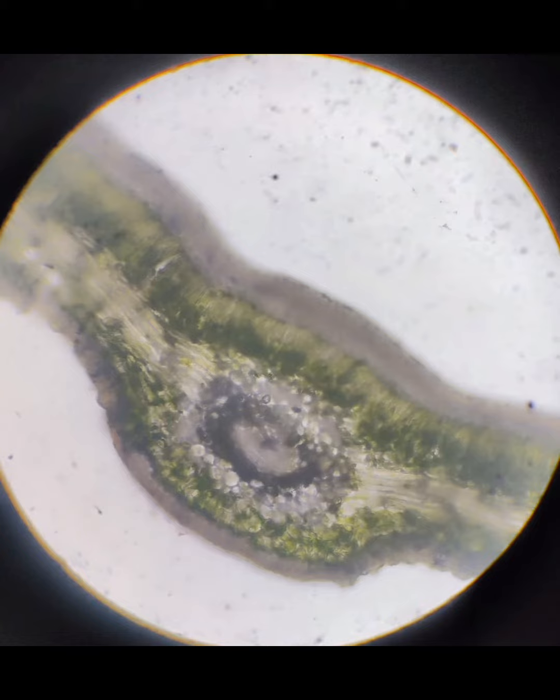The vascular bundle has the presence of diploxylic xylem, that is, the xylem is of two types, centrifugal and centripetal, and upper and lower epidermis can be easily seen. Below here, the plate-like structures are also present above the vascular bundle. These plate-like structures are the parenchymatous cells, which are of the palisade or the plate-like structure.